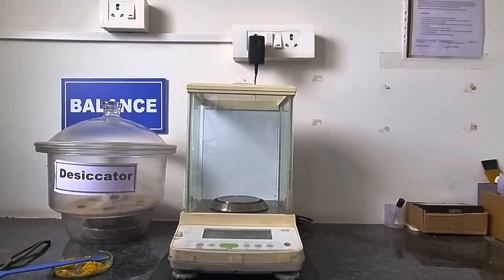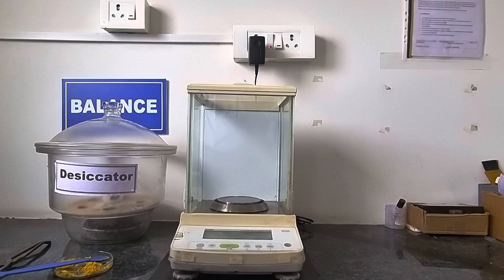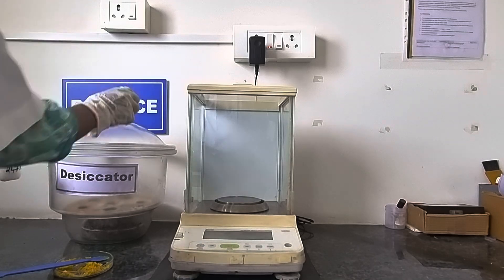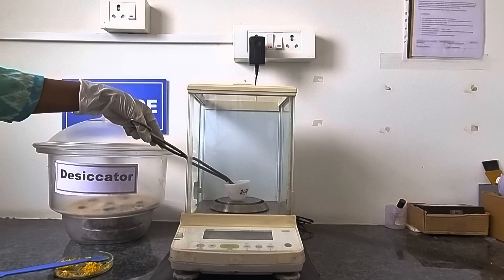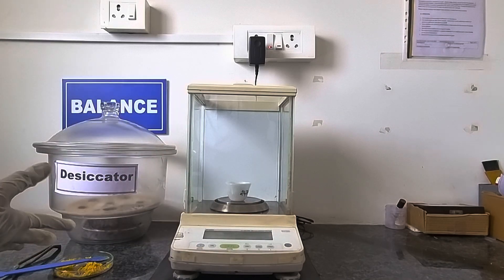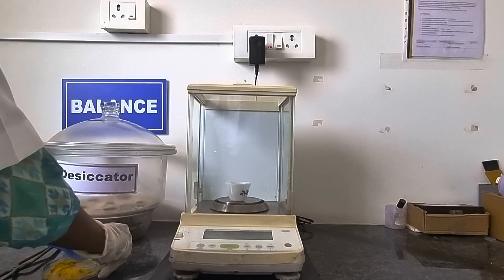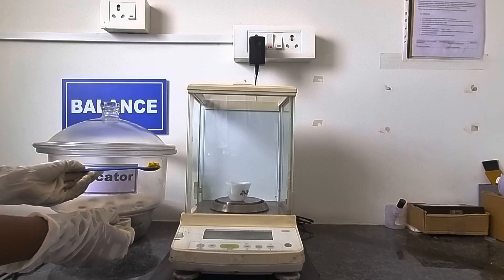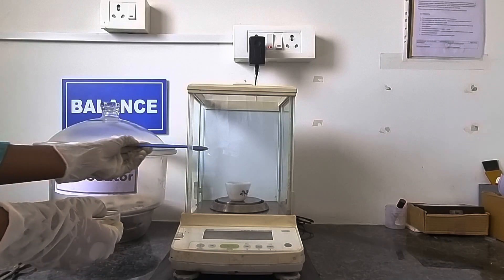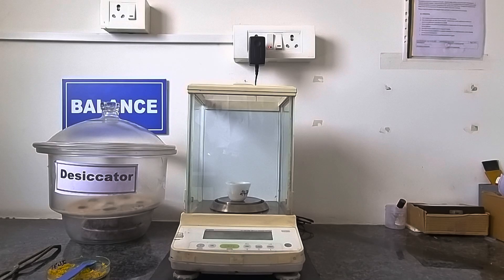After 20 minutes of conditioning of the silica crucible, we will take the initial weight of our crucible. Let's take the silica crucible from the desiccator and we will weigh it. Note down its initial weight of the crucible. After taking the initial weight, we will weigh the crushed sample. Always use the homogenized and crushed sample for ash purpose. We will take approximately 2 grams of sample for total ash content. Whatever weight will come, we will record it in our report book.